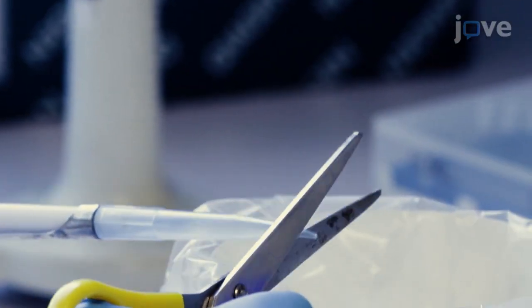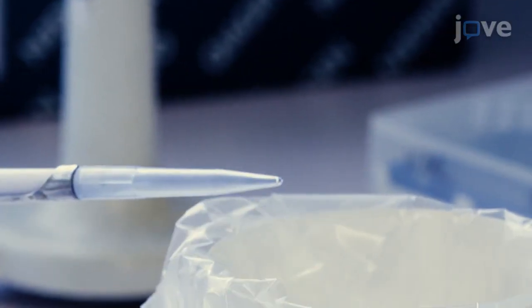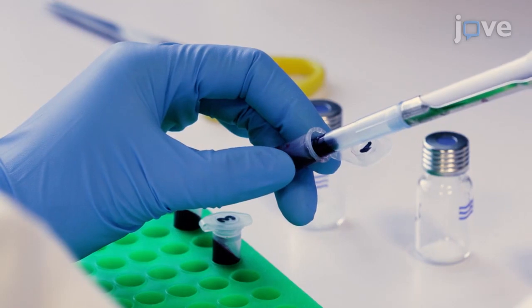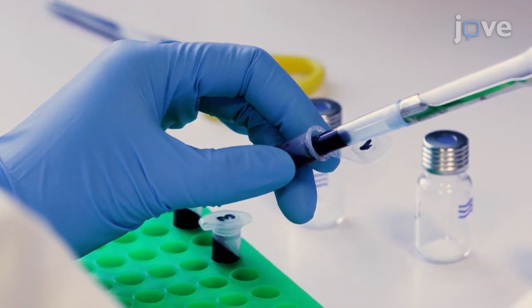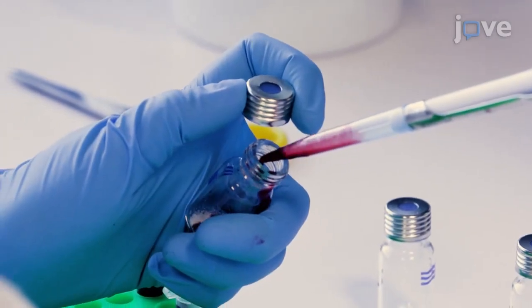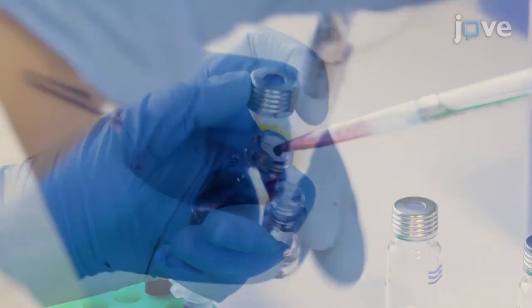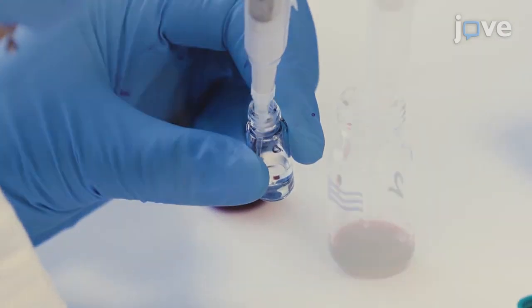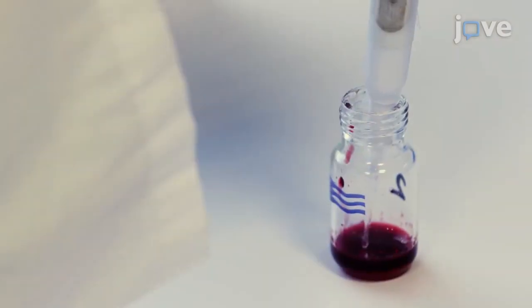Cut the end of the 1000 microliter pipette tip and use it to transfer the supernatant to the sodium chloride-containing headspace vial. Add 5 microliters of internal standard to each sample-containing headspace vial.